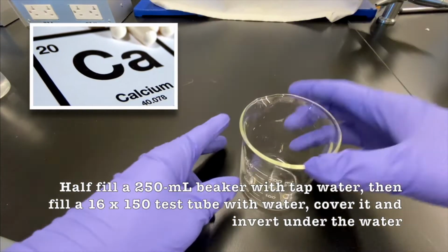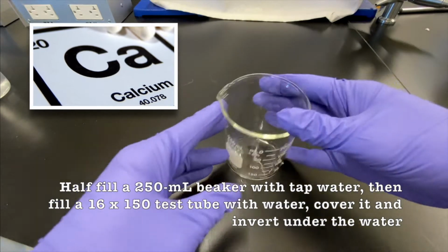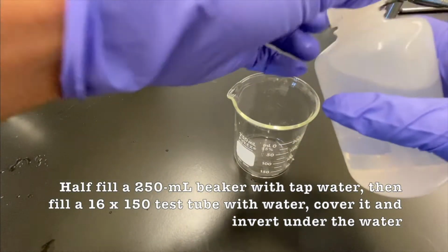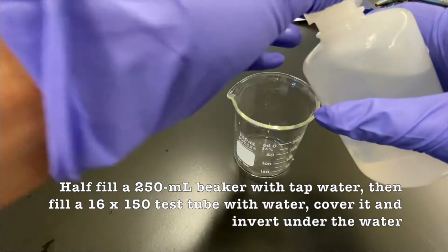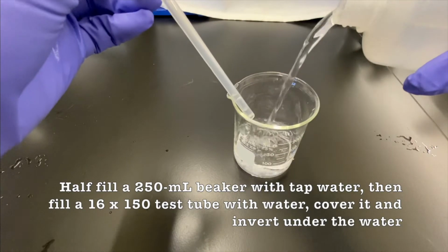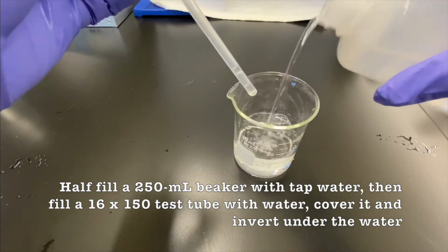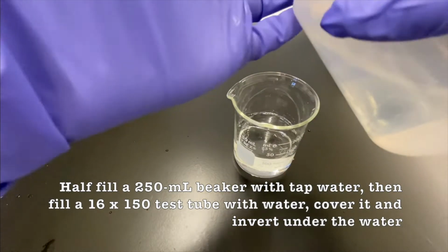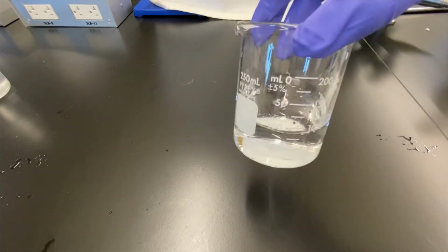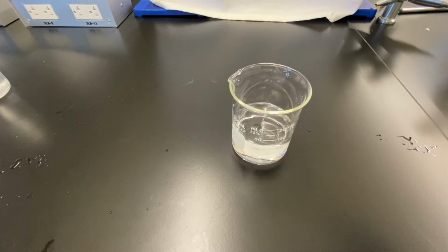Alright, so we're going to start off first by half filling a 250 milliliter beaker with tap water. Okay. Spilled a little bit on the side, that's okay. And why are we doing this? Well, you'll see we're about to fill a 16 by 150 test tube with water as well, and we're going to invert it and flip it into the beaker.